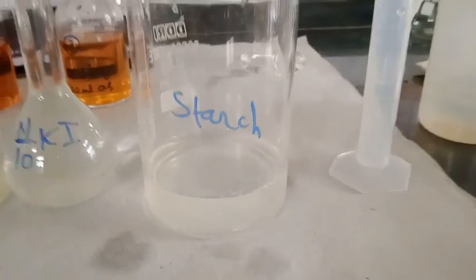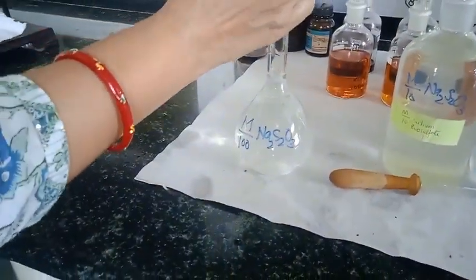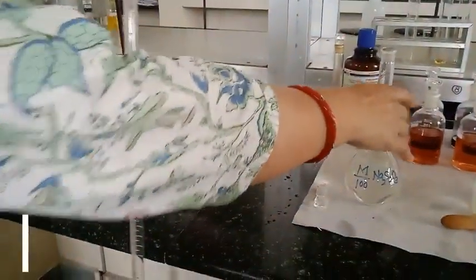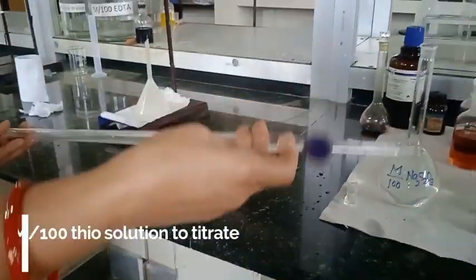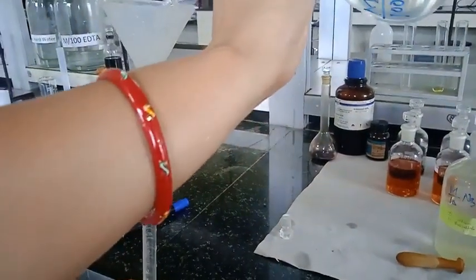So for that purpose I have dissolved 1 gram of starch in warm water, heated up to 70 degrees centigrade, then cooled down to room temperature and filtered it. Now we are going to rinse the burette with the M/100 sodium thiosulfate solution. After rinsing, I am just going to fill it.